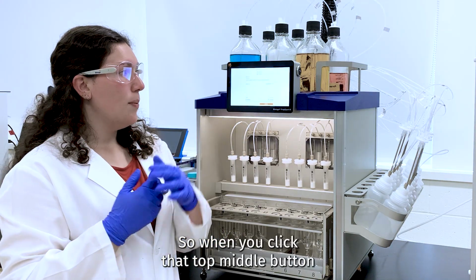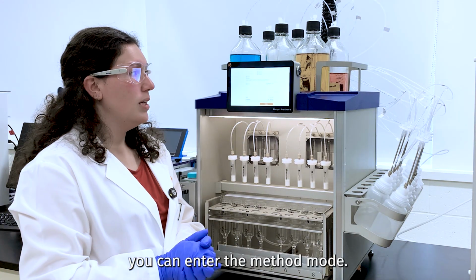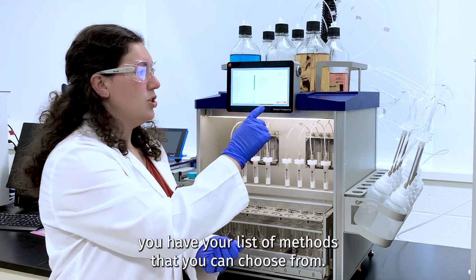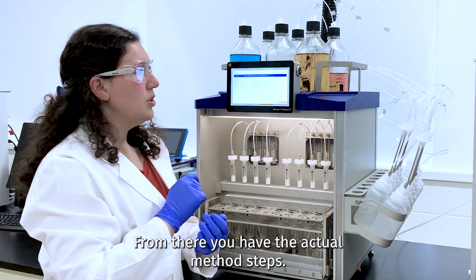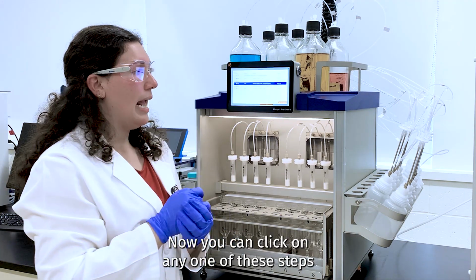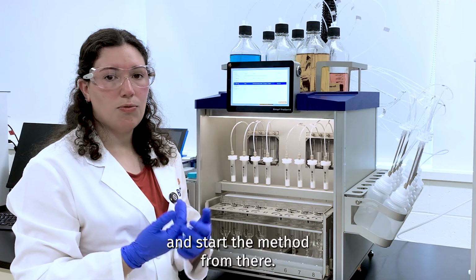Now you can also enter method mode. So when you click that top middle button, you can enter the method mode. And from the top button here, you have your list of methods that you can choose from. From there, you have the actual method steps. Now you can click on any one of these steps and start the method from there.